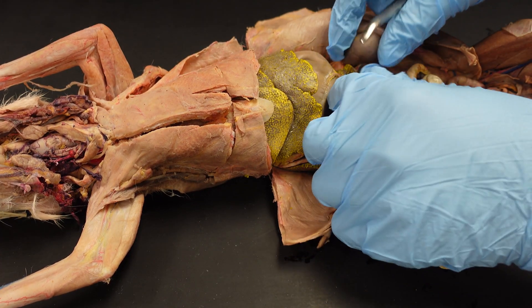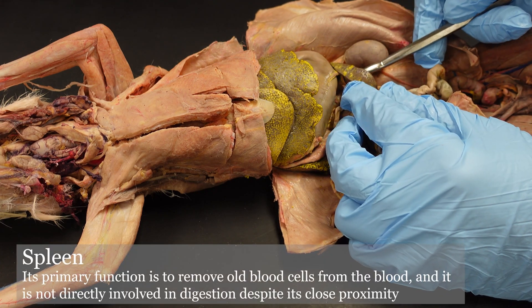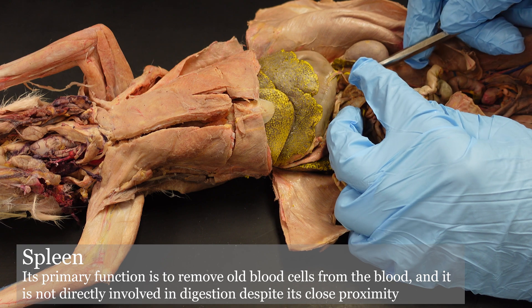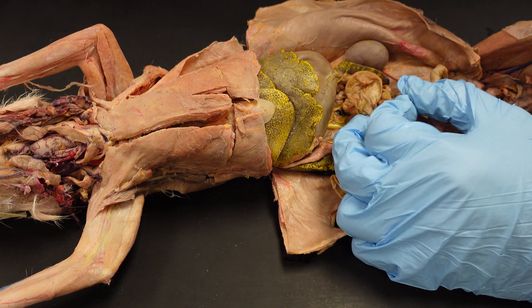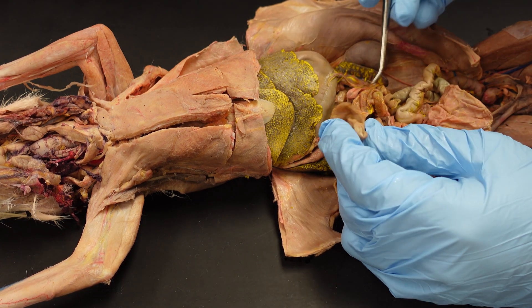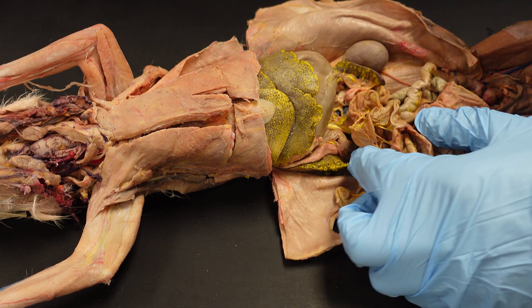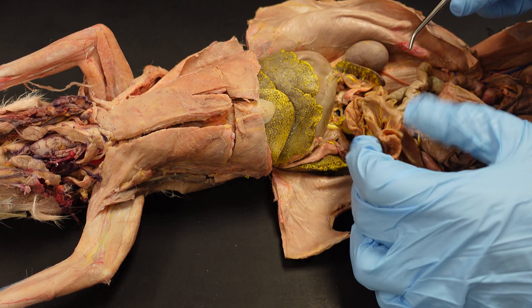Tightly associated with the stomach is actually the spleen, which is not necessarily part of the digestive system itself, but it plays a role in recycling blood cells.